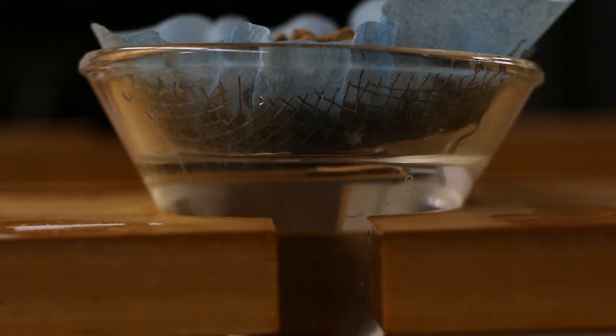Before you're done, double-check that the water level is touching the soil. As you can see here, the soil can absorb quite a bit of water once it comes into contact with it. And if the water level sinks too far below the mesh, the nematodes might not want to crawl through.